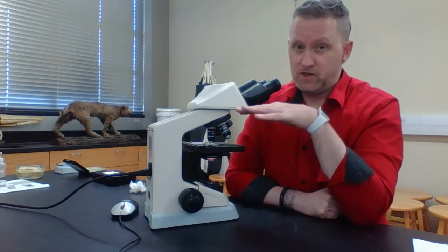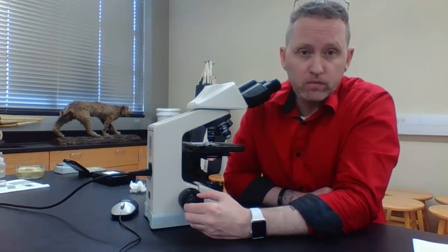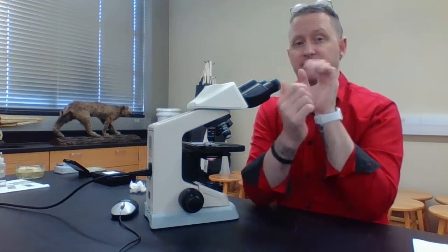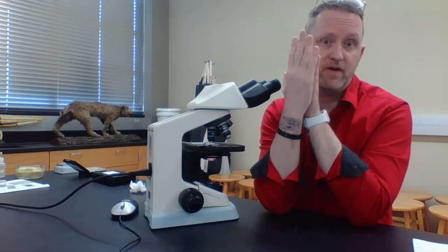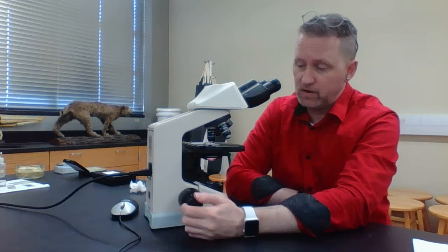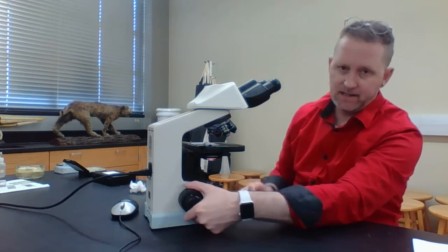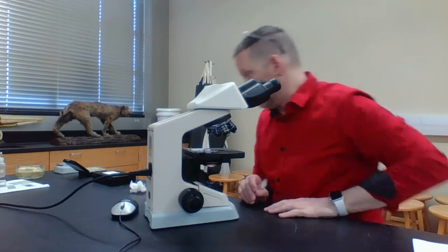So once you increase your magnification to low power, high power, or the oil immersion, only use your fine focus. Increasing magnification decreases the field of focusable view that you can actually see. And notice how close this objective is to my specimen. So don't use your coarse focus. When you're done, go back to your scanning, twist it, and put this away. So we're basically done with the colored threads.